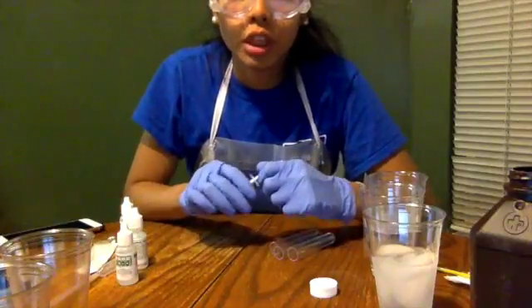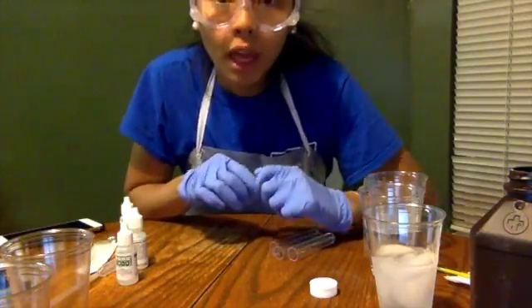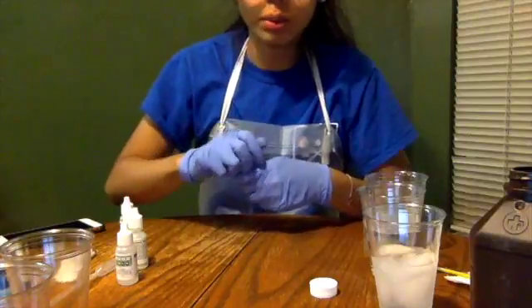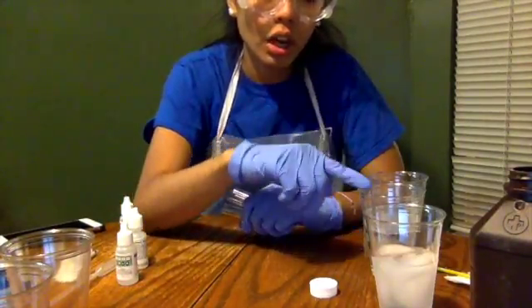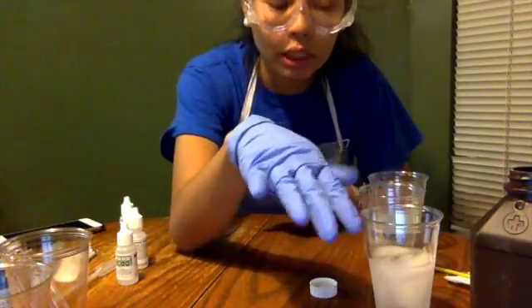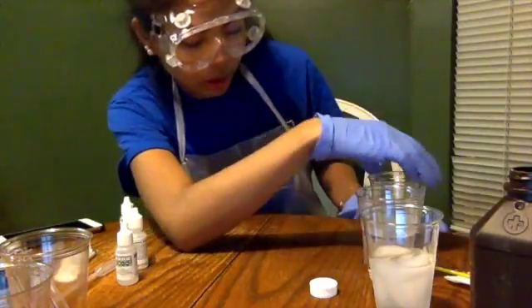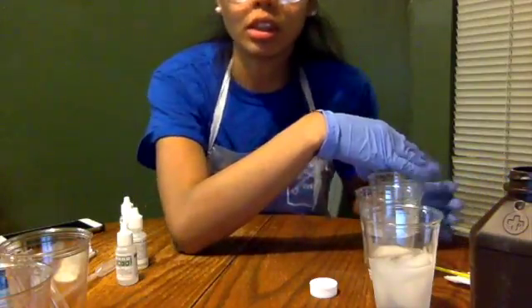So we're going to move on to activity 3, which is going to test the temperatures for the chemicals. So you have to take 3 test tubes. We're going to test the water baths. We're going to have room temperature water, hot water, and ice water. And the cold one is approximately 5 degrees Celsius, and the hot water is approximately 45 degrees Celsius, and the room temperature is roughly 25 degrees Celsius.